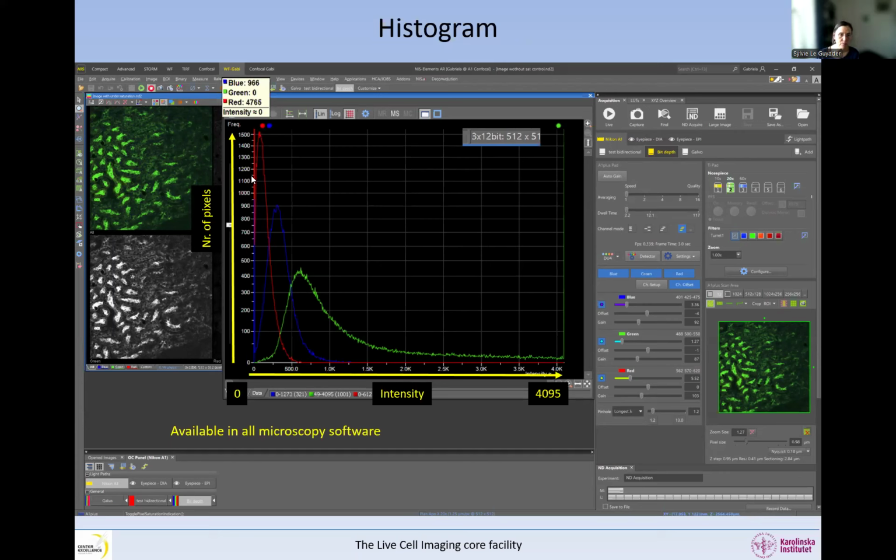And if we look at the pixels that are at 0, we can see here there is a line of blue and red, right spot on the 0. So if we look at the intensity of the 0, we can see that we have many pixels in the blue channel and many pixels in the red channel that are underexposed, and they have this 0 intensity, whereas the green channel is not underexposed. And if we look on the other side, we can see the opposite. So the green channel has many pixels that are overexposed, but the blue and the red channel are okay.